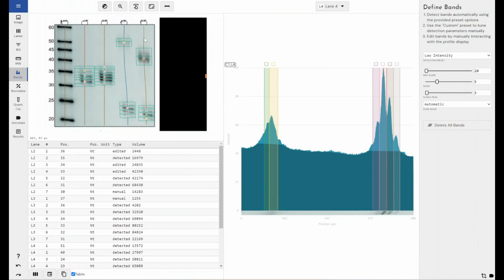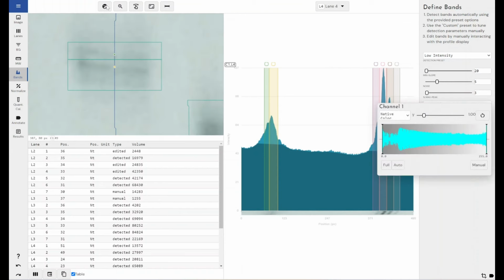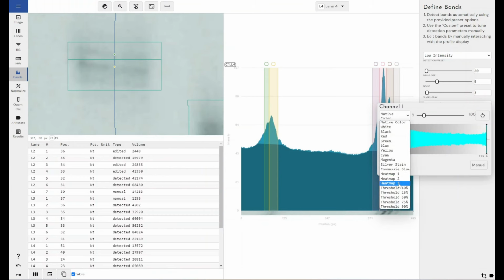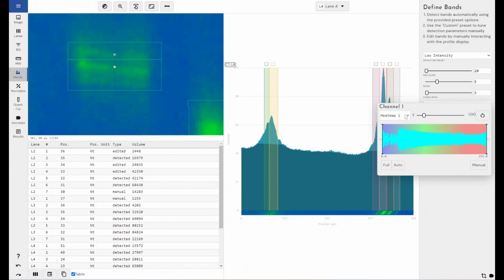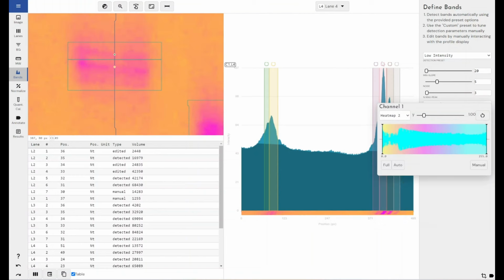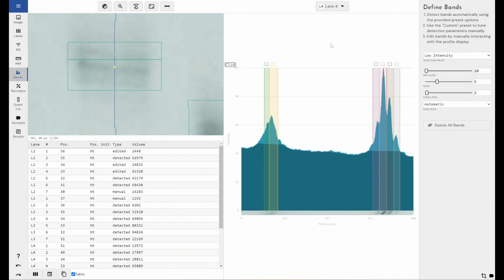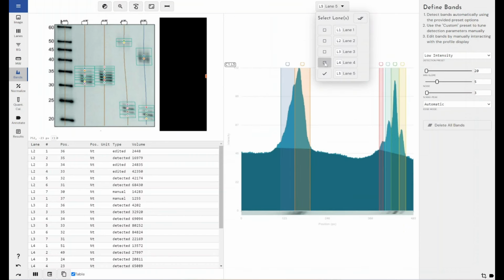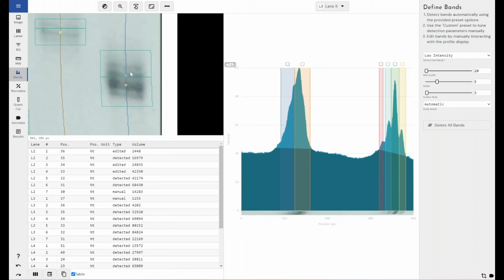So now we're coming down to lane 4. So this is lane 4 here. Just having a look at these bands here. And again, if I want to change any of the contrast or anything like that to try and make my bands more visible, I can do that within this view as well as the image setup view that we saw before, using things like heat maps, etc. So I'm happy with that, and then lane 5 is somewhat all over the place. So let's have a look across here. This is a very smeared band. It's very difficult even with the data to determine where bands start and end. And I'm going to leave it at that for now, just as an example.